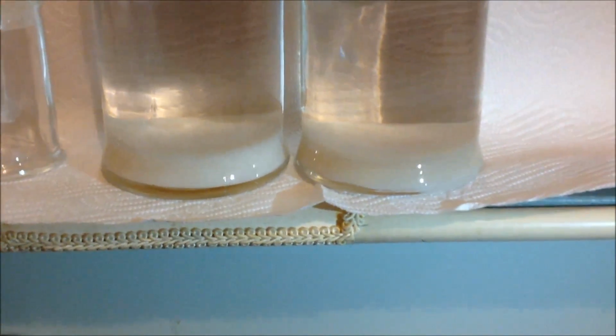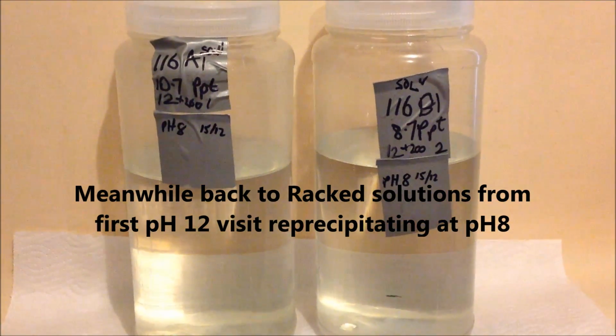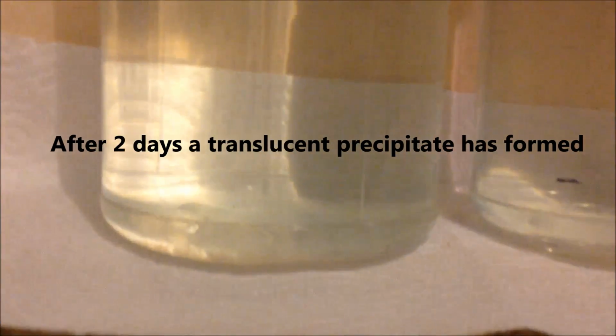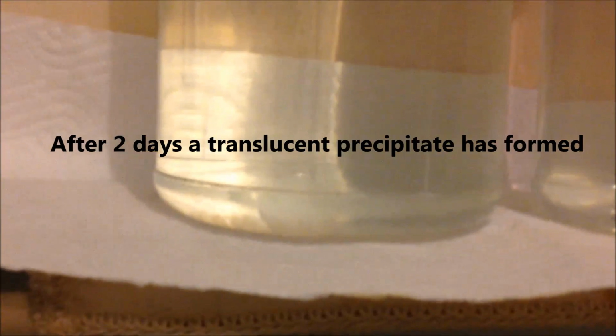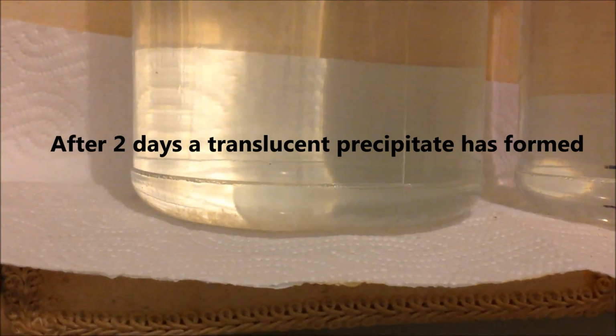settle properly. The two solutions have now been sitting at pH below 9 for a couple of days, and look, there's a very small amount of translucent precipitate. I think you can just grab it there. If I can get my other hand in the shot.